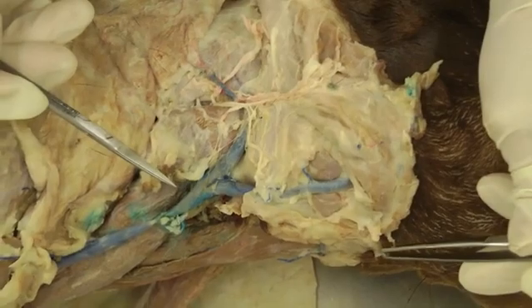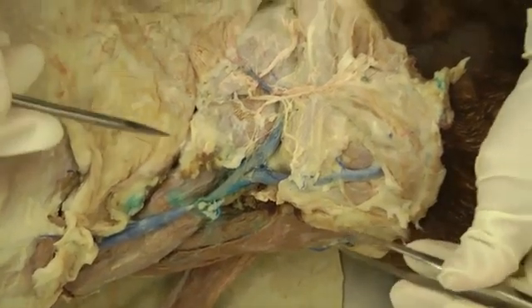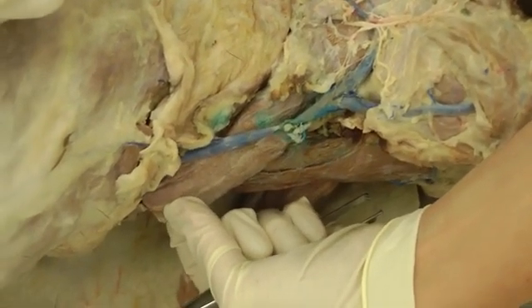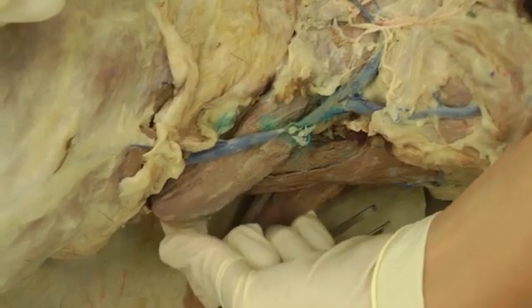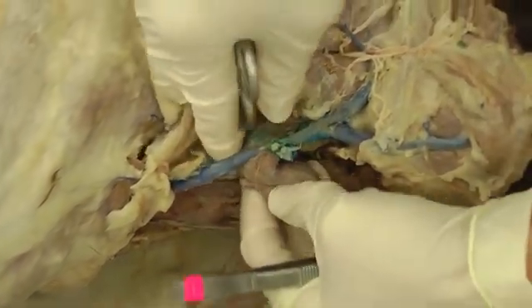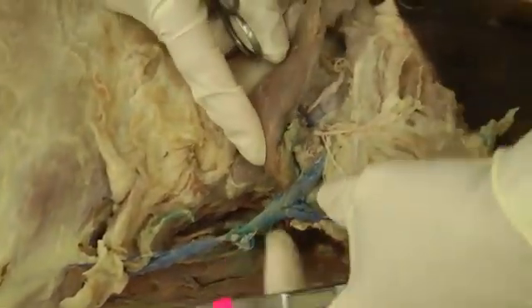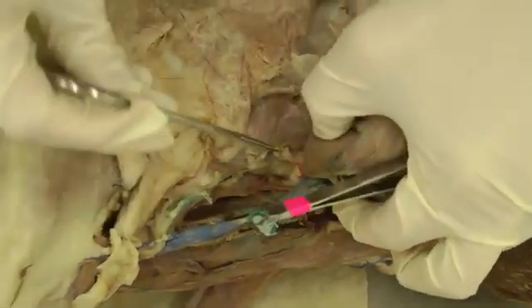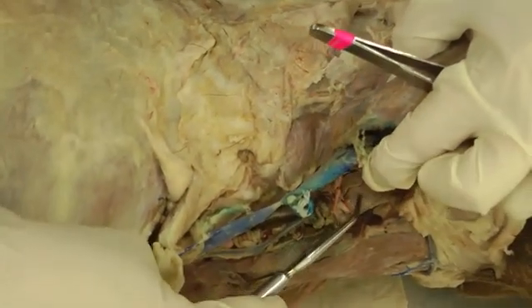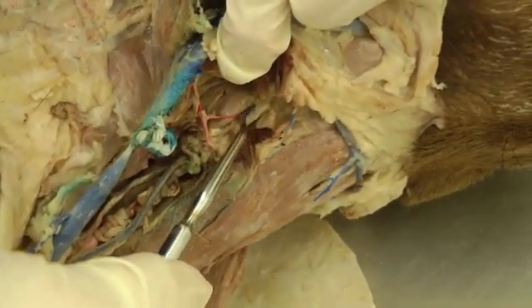Then we're looking for the medial retropharyngeal lymph node, which can be hard to find in this dissection field. Your book is going to tell you to cut several things, one of them being the sternocephalicus. Typically I just take off enough tissue to isolate the borders, then cut it — the book also tells you to cut your jugular, which will make this easier to reflect. After reflecting the sternocephalicus, you should be able to find the retropharyngeal lymph node — a big oval body right here.